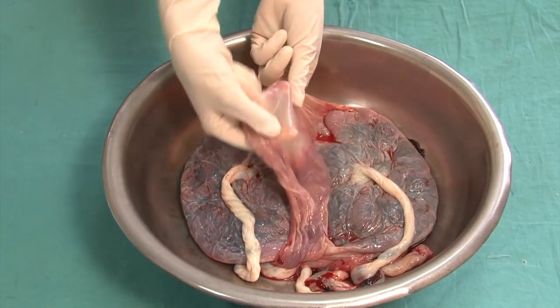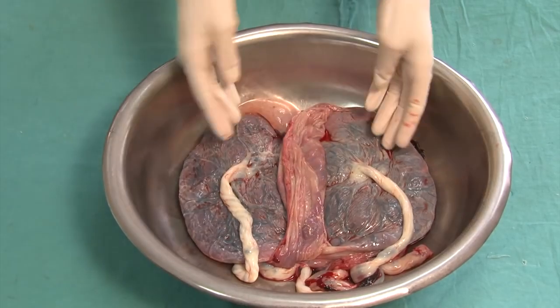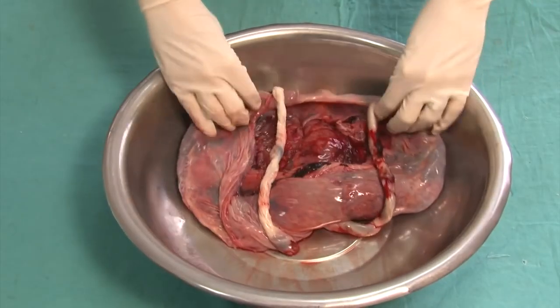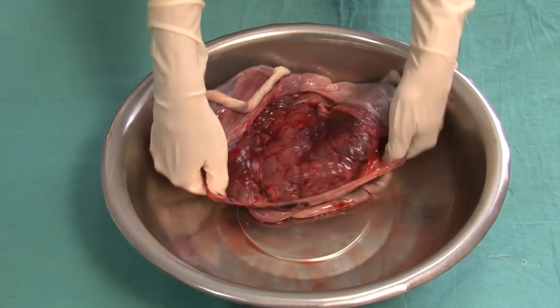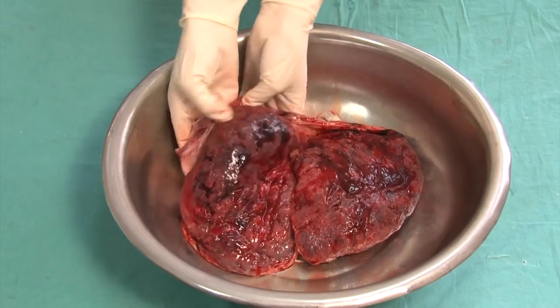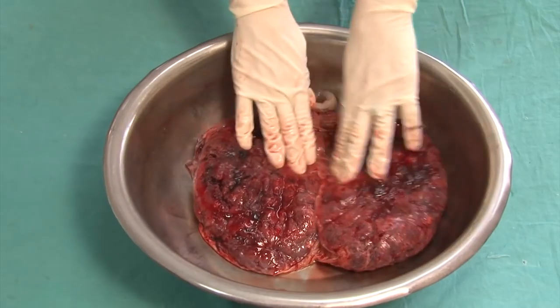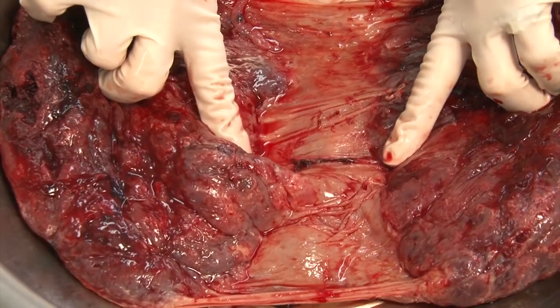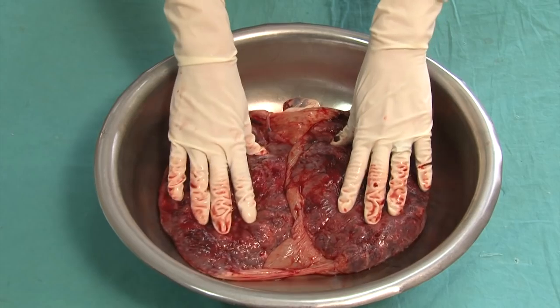One set of membranes is allocated to one of the placentas, and a second set of membranes to the other placenta. The placentas are now turned over from the fetal side to the maternal side. The membranes, which are turned inside out from the amniotic sacs, are moved out of the way to gain access to the surface of the two placentas. By spreading them apart, it becomes clearly visible that they are two separate individual placentas linked to each other only by membranes.